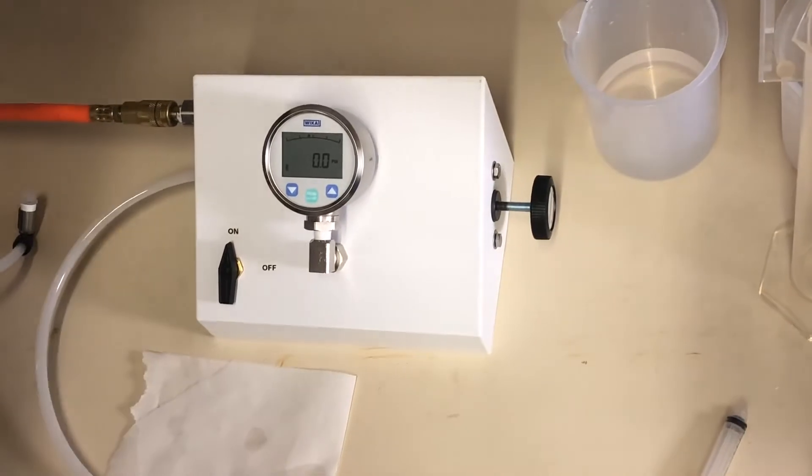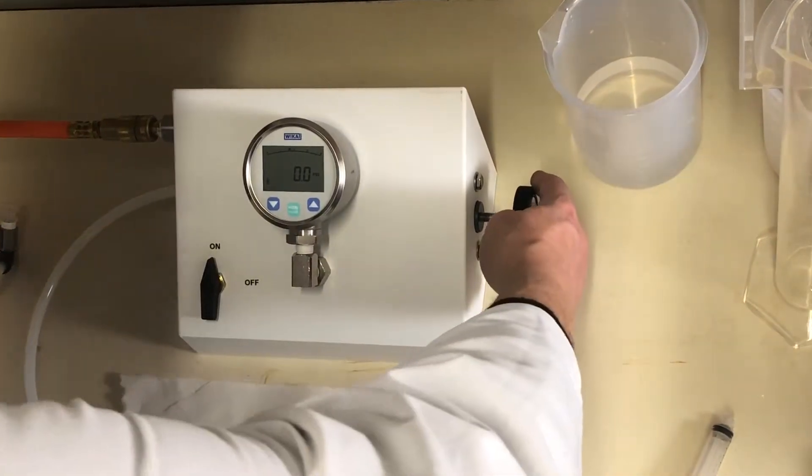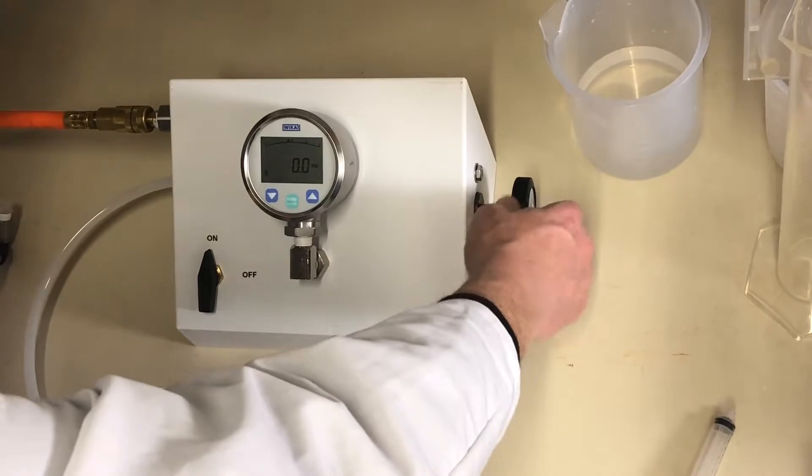And then we'll apply pressure to what we'll think is approximately 50% of the water entry pressure for 0.45 PTFE. Once again, I'm going to guess maybe around 15 to 20 psi. So we'll pressurize that to 15 to 20 psi.